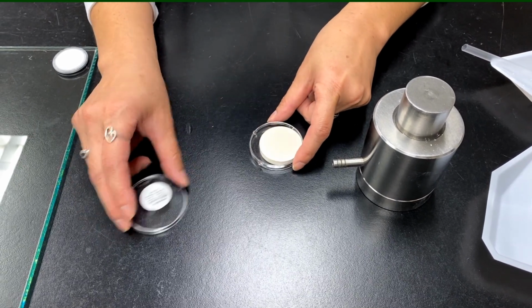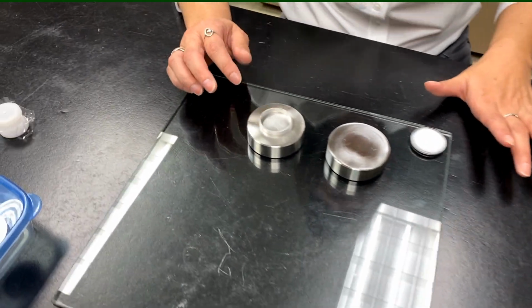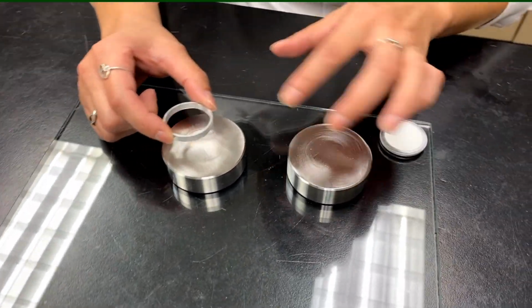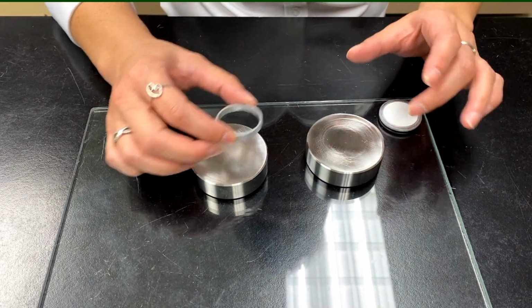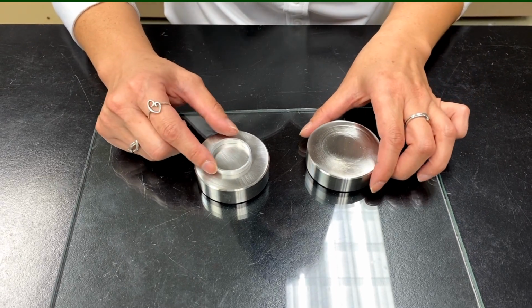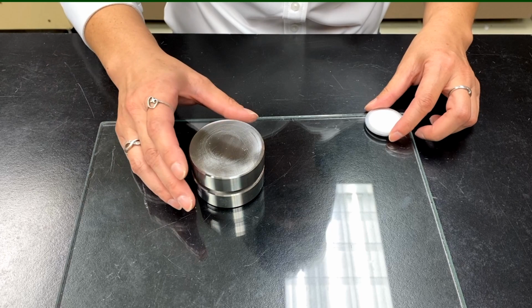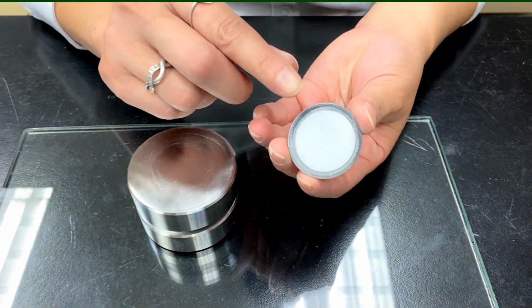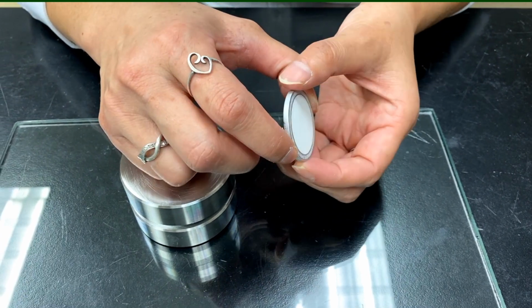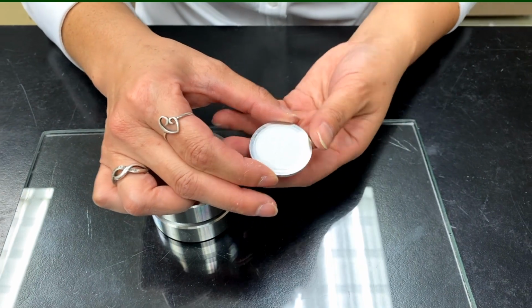Now another alternative way, which is a little bit easier, would be pressing it with a pancake press or any kind of stainless steel die presses. In order to hold it, because there's no shape for it to go through, use an aluminum ring, pour the powder in directly, and then just sandwich it and press it down to 10 or 15 tons. Once that is pressed, it compresses the aluminum ring and binds the sample into the ring, and you can analyze either side of this.